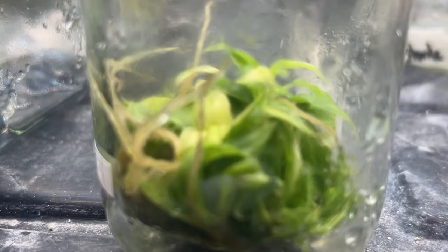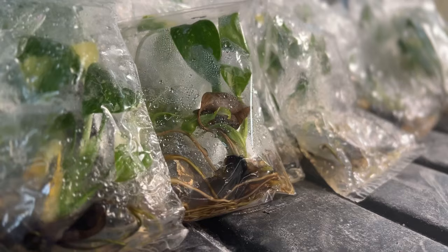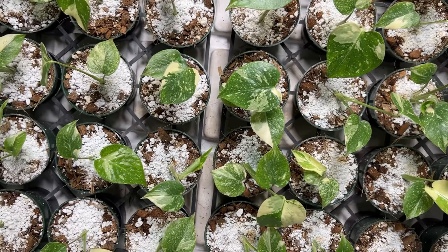After the multiplication stage comes rooting, wherein auxin such as NAA is used to induce rooting. After a few weeks in the media, plants are then ready to be transitioned into a highly controlled greenhouse. After this acclimation process, they are ready for a typical greenhouse environment.